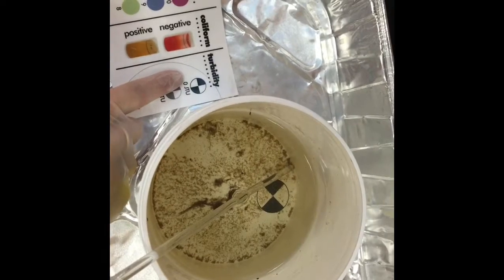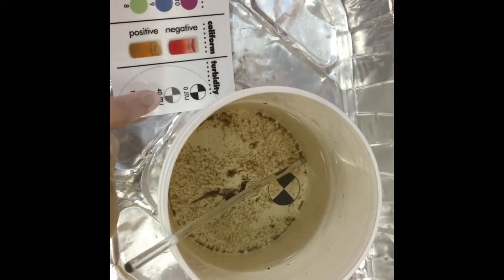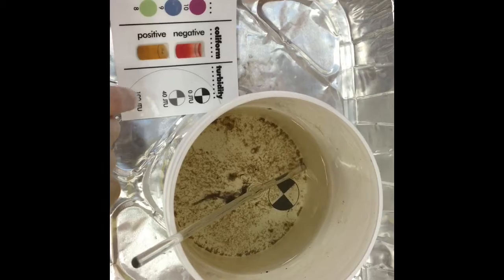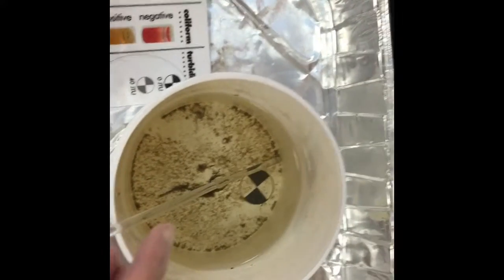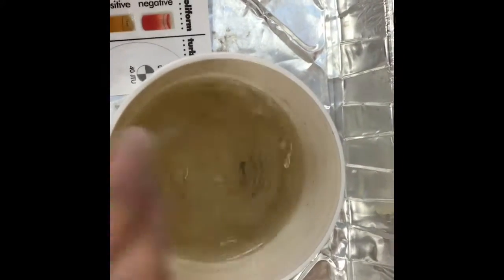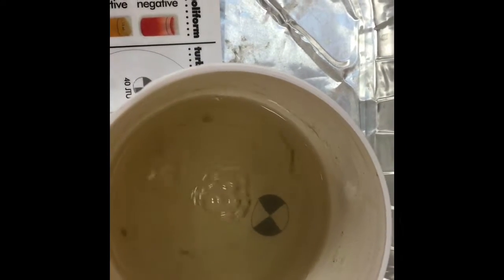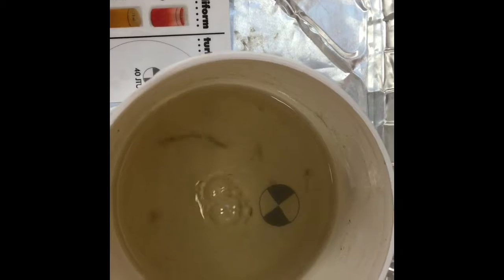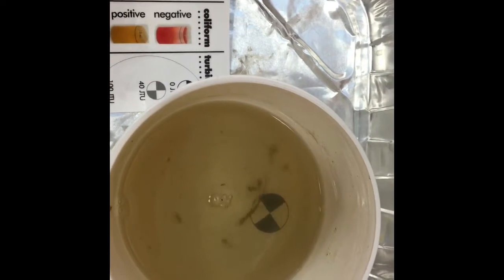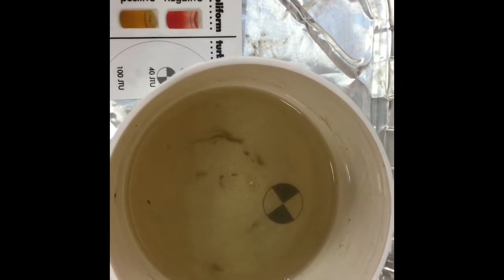If it's crystal clear it'll be 0 JTU — that would be like drinking water. If you can kind of see it, it's about 40 JTU, and if the circle disappears almost completely it'd be 100 JTU. After stirring, it's definitely not clear like drinking water, but I'm not sure it's up to 40. It's definitely not 100. I'd say the turbidity of this water is maybe 20 JTU.